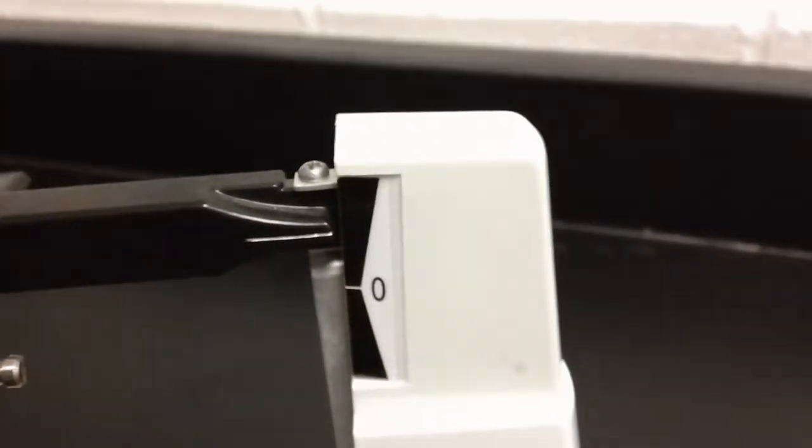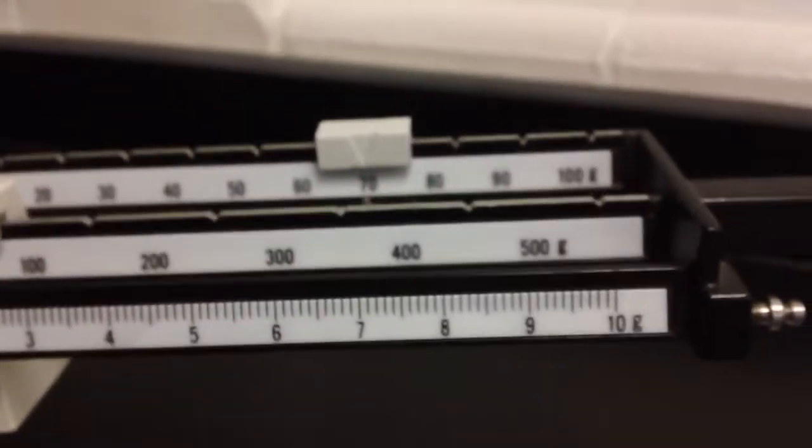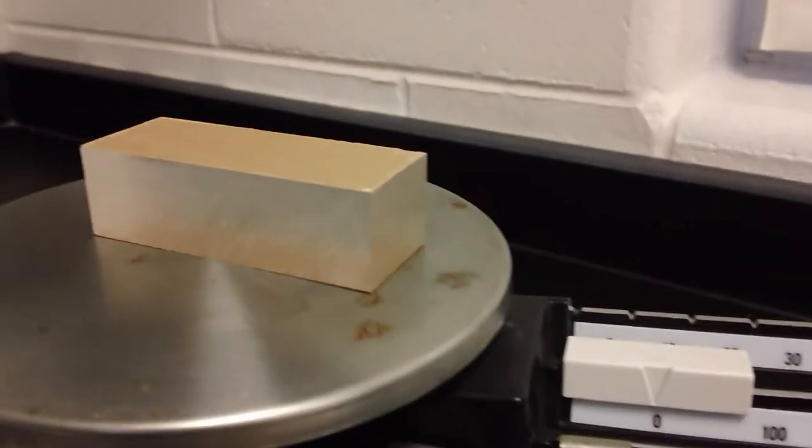Okay. 70 is not quite enough mass, but 80 is too much. So automatically, we know that this block is somewhere between 70 and 80 grams.